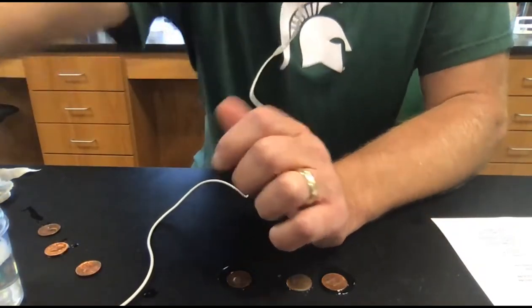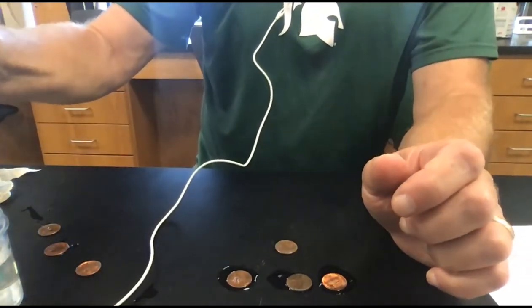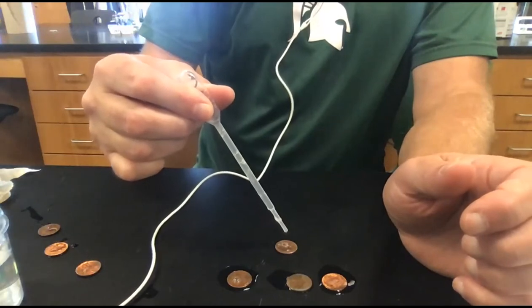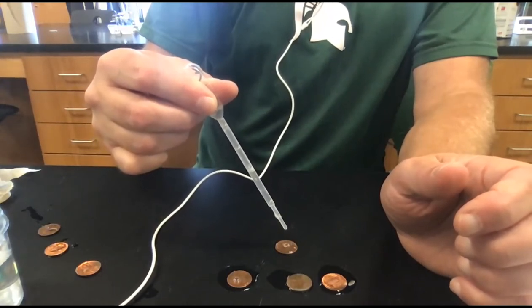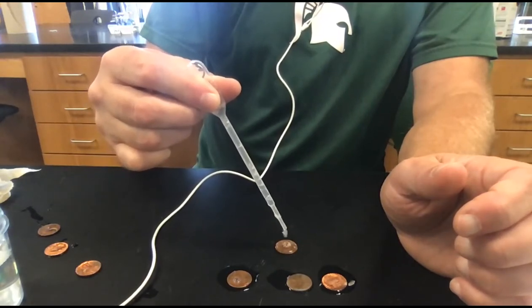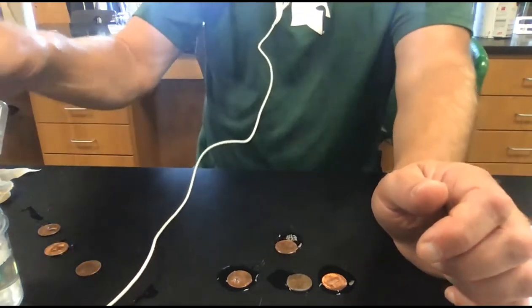So 18 and 15. 1, 2, 3, 4, 5, 6, 7, 8, 9, 10, 11, 12, 13, 14, 15, 16, 17, 18, 19, 20, 21, 22, 23, 24. That one broke at 24.